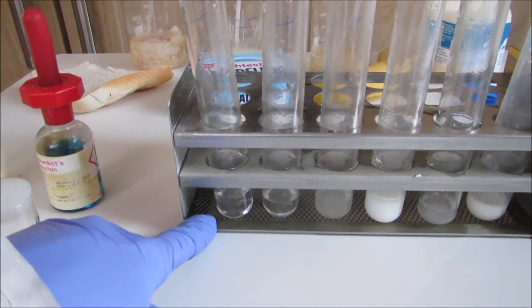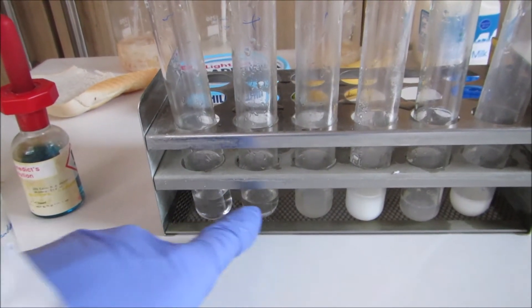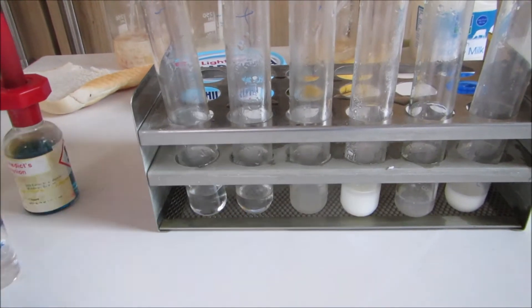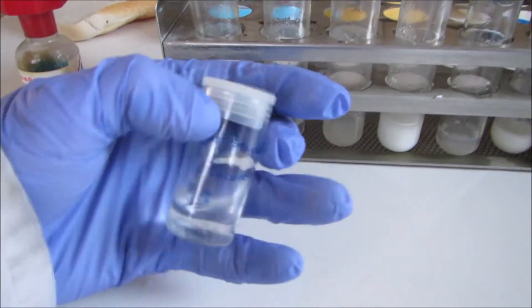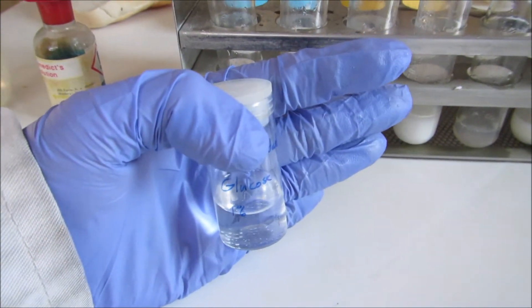I put deionized water as my negative control. My positive control is in the second tube and this time it is a glucose standard.